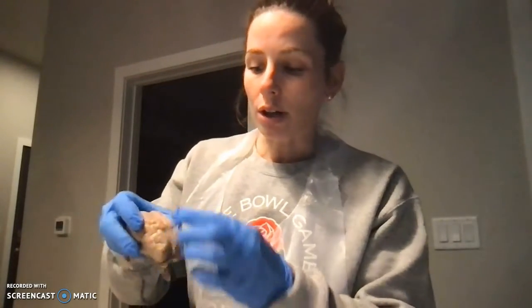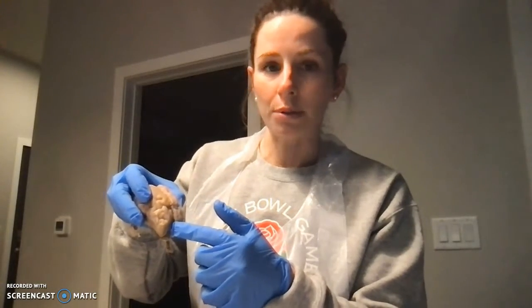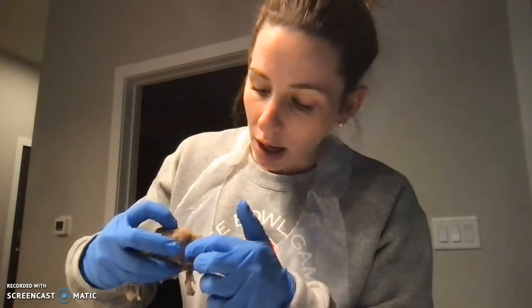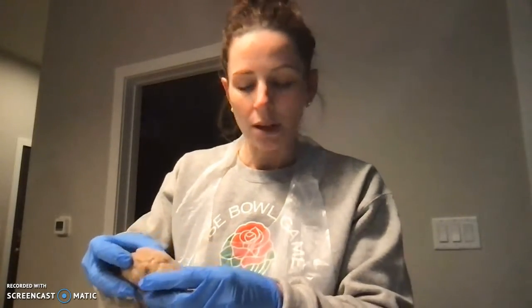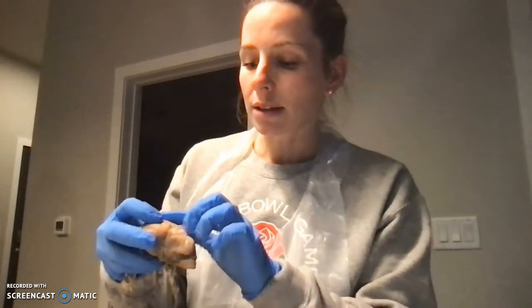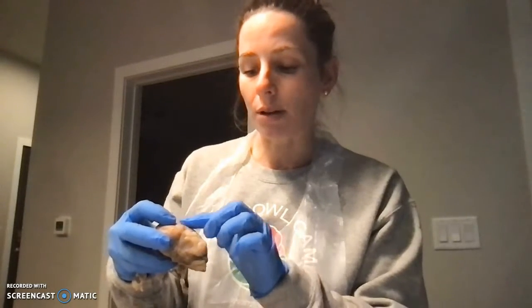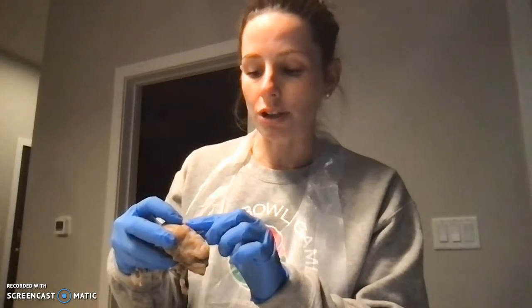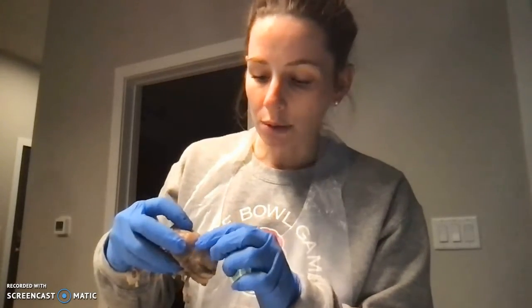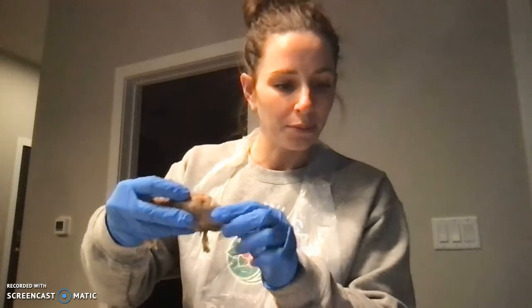Then we have our longitudinal fissure, which runs down the center of the brain sagittally, and then this other deep line through the side is the lateral fissure. On top of the brain, this whole material on top is called the cerebral cortex. It makes up all of these little bumps and ridges, which are called the gyri. And in between each of these gyri, these little squiggly lines are the sulci.